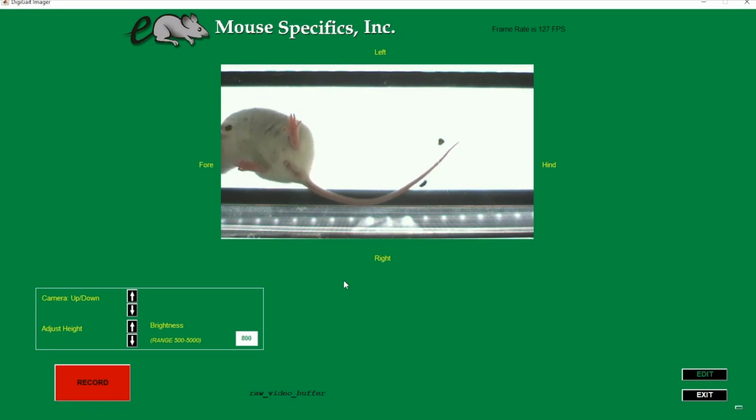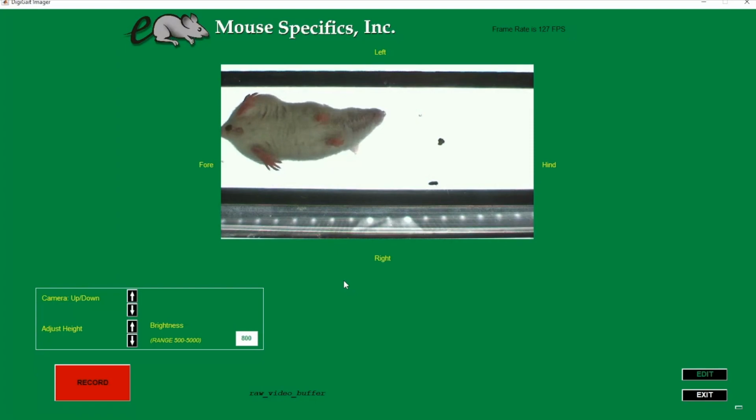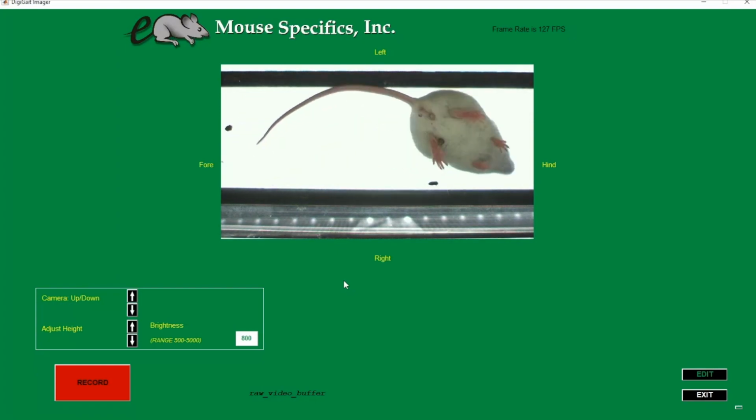Twist the bottom ring on the camera lens to adjust the exposure. We just want to get in the general area here, as we will fine-tune the brightness in the software. Close the treadmill door and let's finish up the brightness.